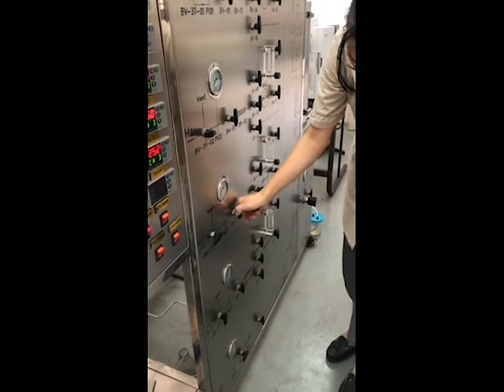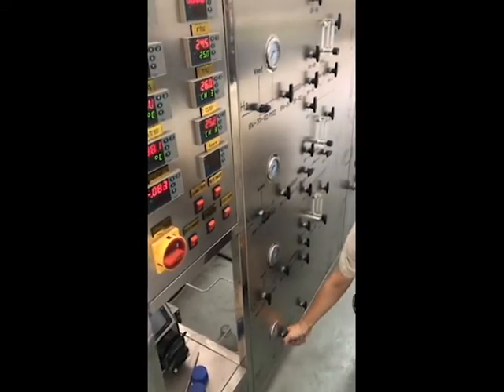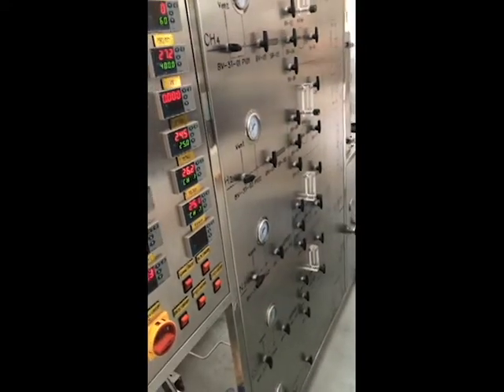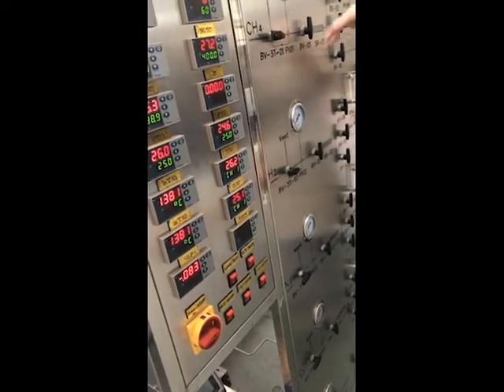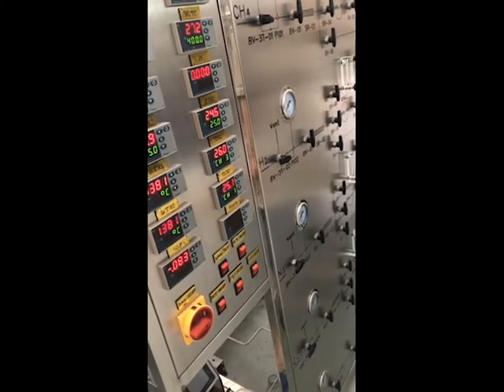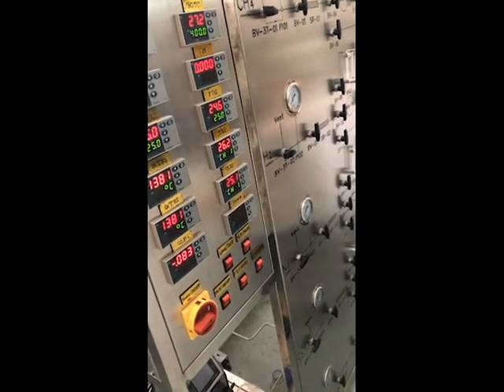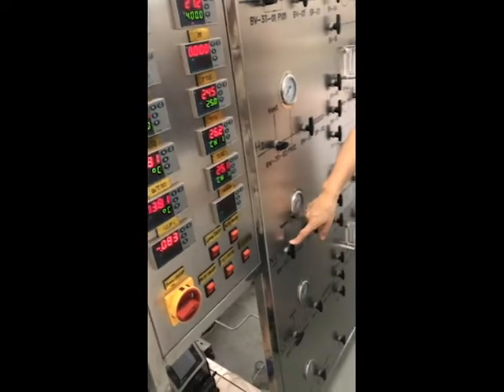Like just now, you're not closed. Every valve is closed. You can see, not closed. Check one by one. All the valves are vertical type, except the three-way valve, which is horizontal type, because this one is closed. So double check all your valves. Make sure all the valves are closed. Then you can start to send the gas, give the gas supply, let the nitrogen go to the system.